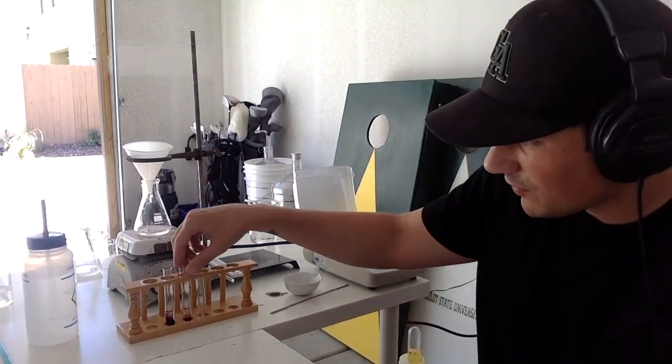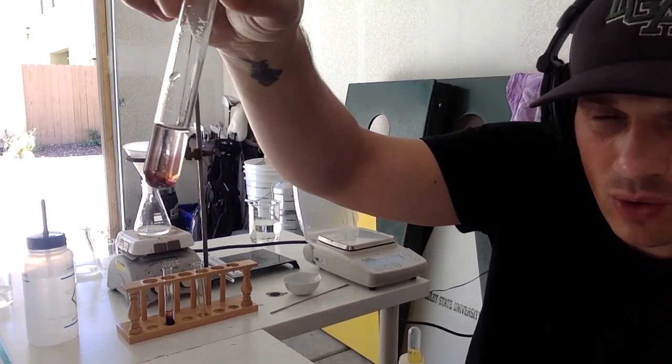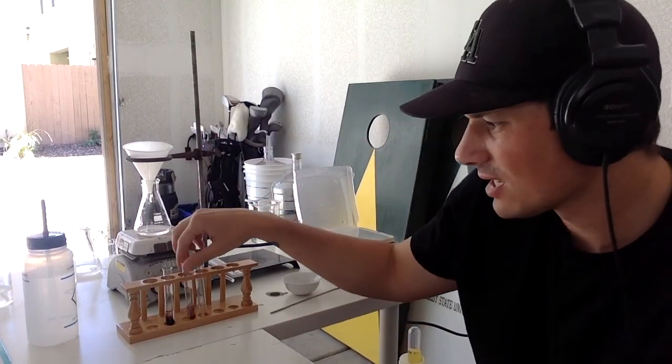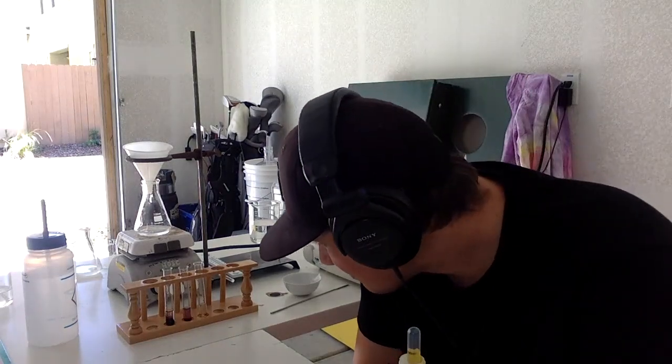Pro level. Not really. So if you take a look, I have a little of both in there. You can see that orange tinge to it, but those crystals at the very bottom, those large crystals in there, are still some leftover salicylic acid. So I kind of got a perfect combination of both, which means that we have a horrible percent yield and we really didn't get what we should have gotten. So all in all, it's okay. You know, it is what it is.